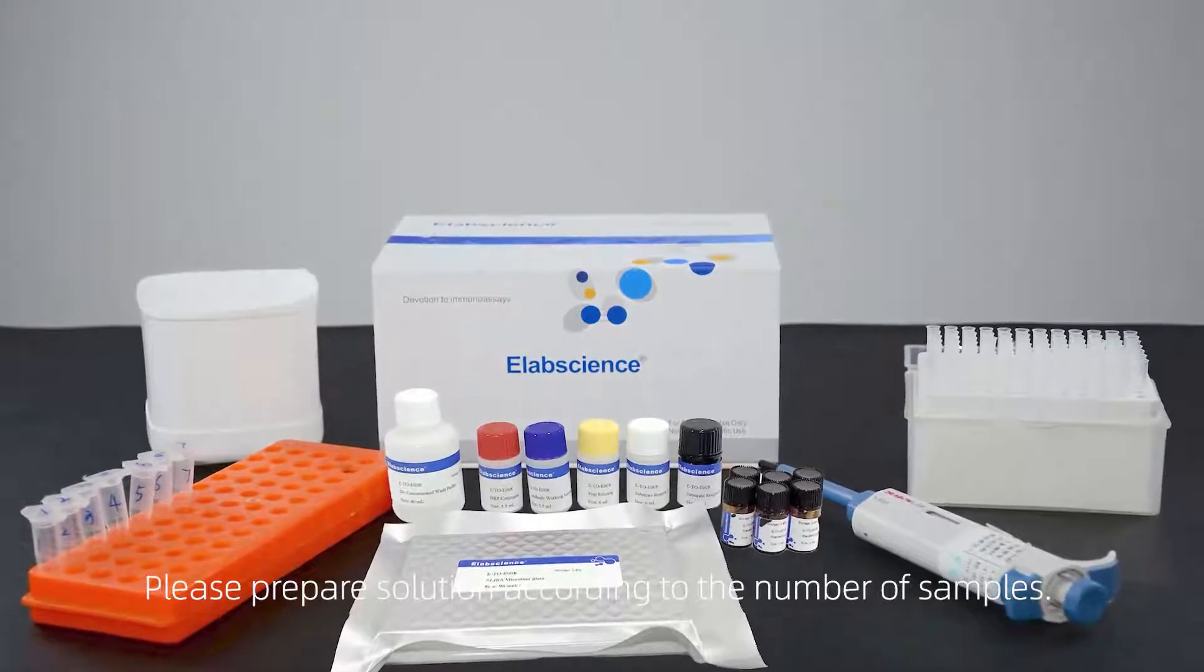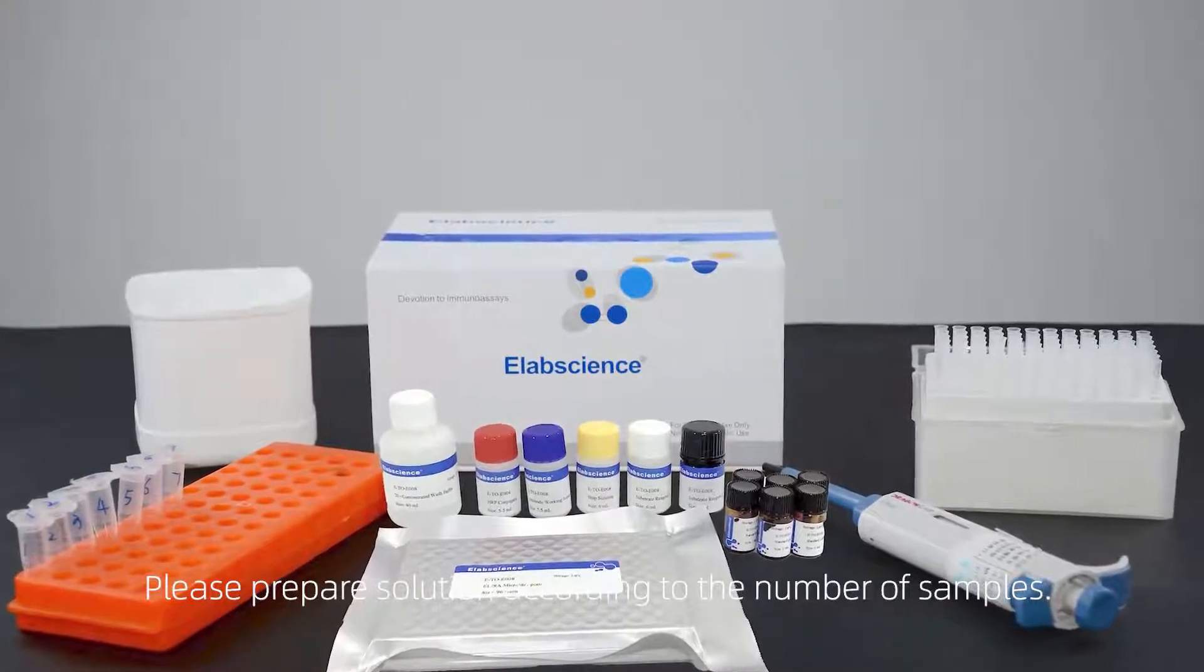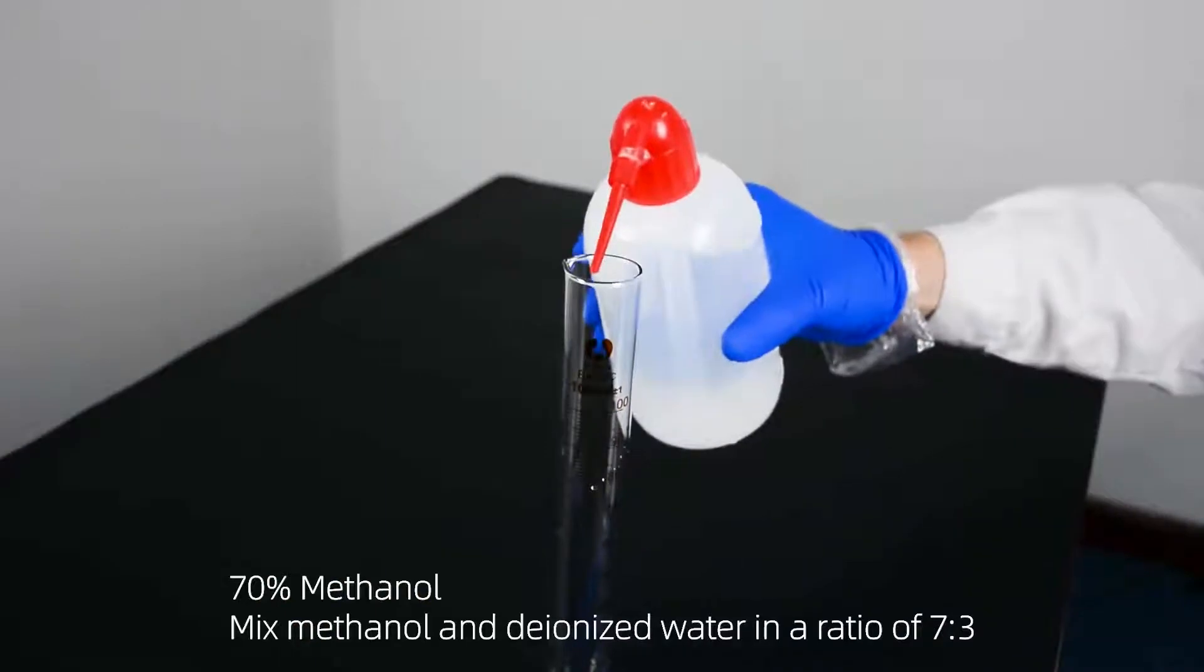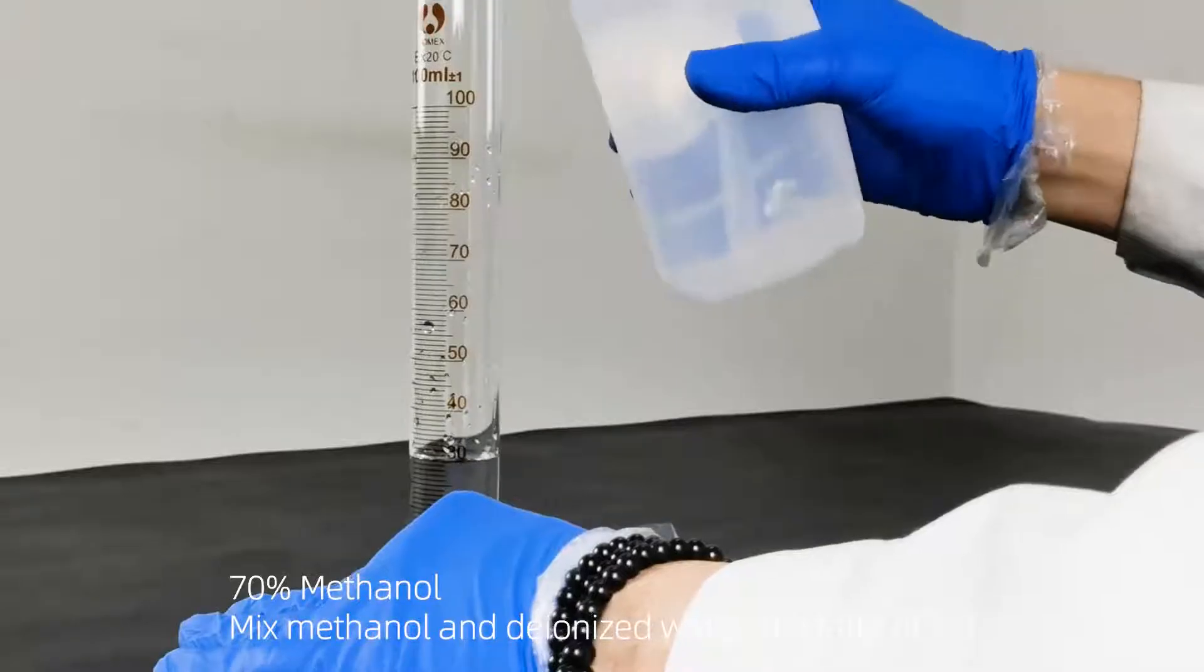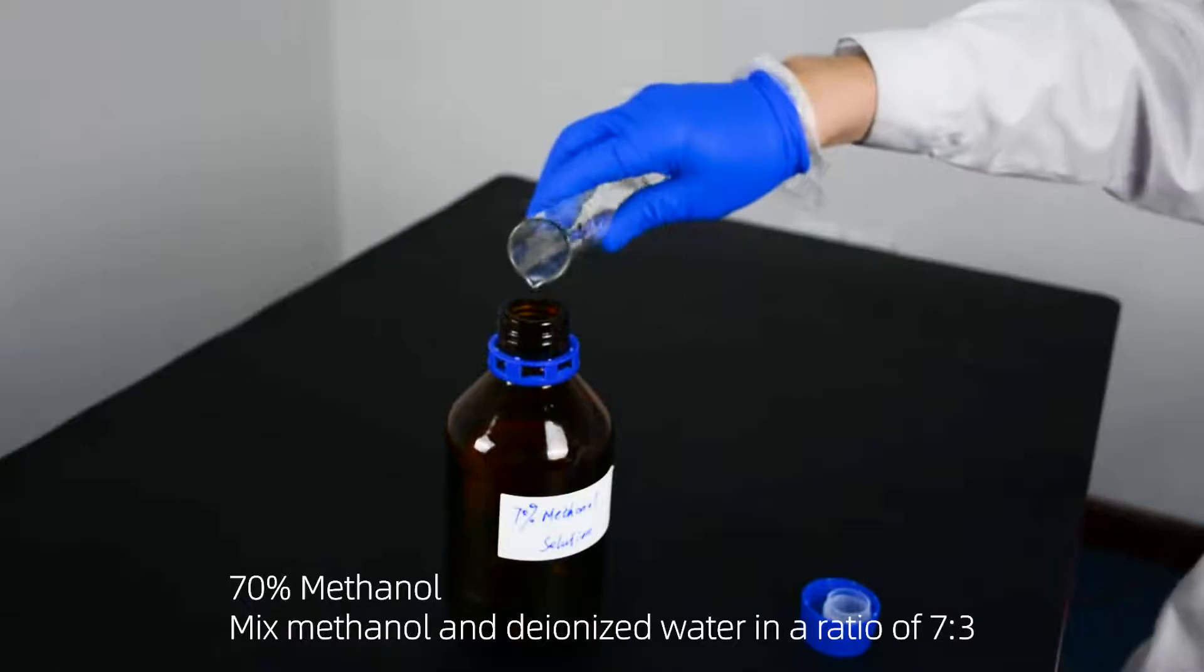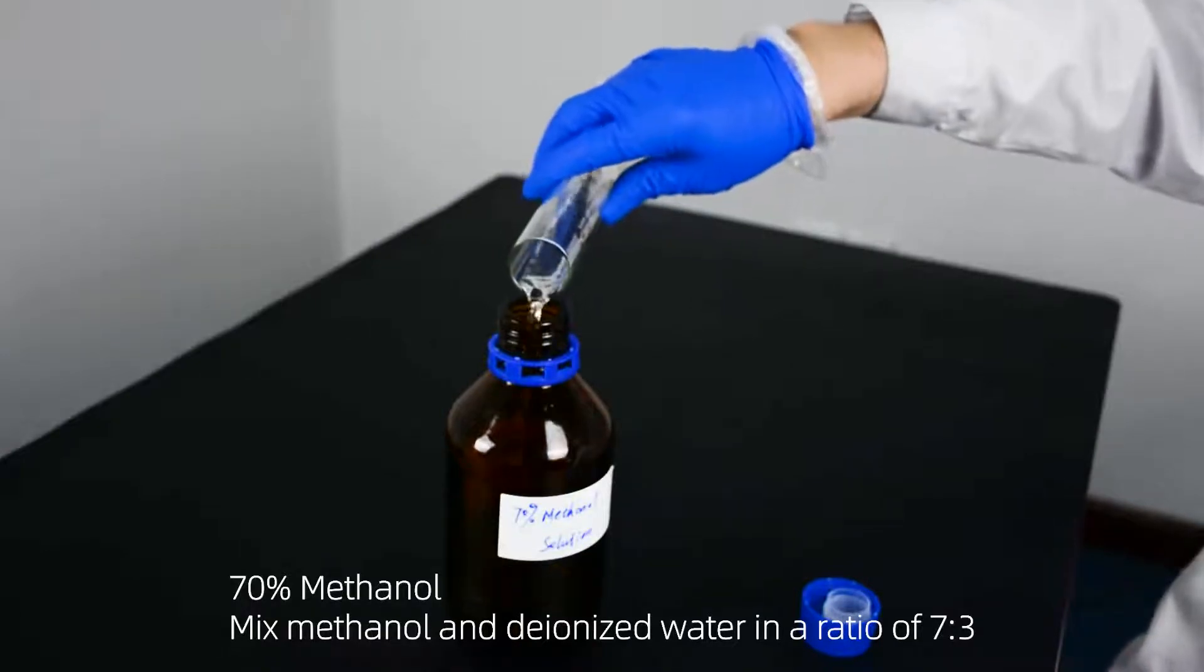Please prepare solution according to the number of samples. 70% Methanol: Mix methanol and deionized water in a ratio of 7 to 3.